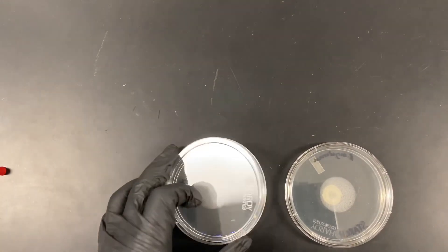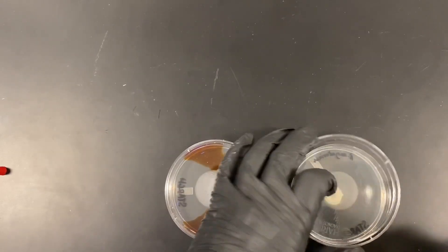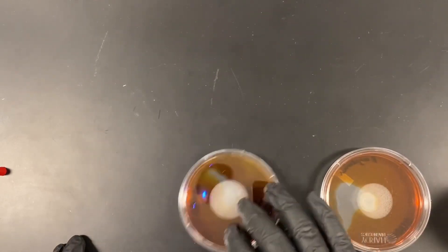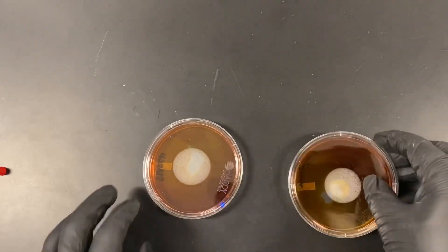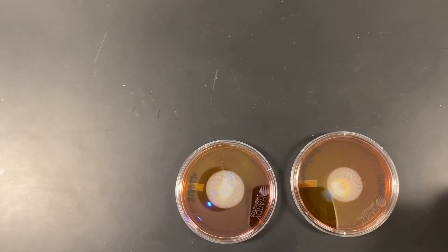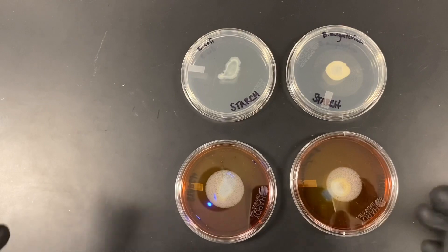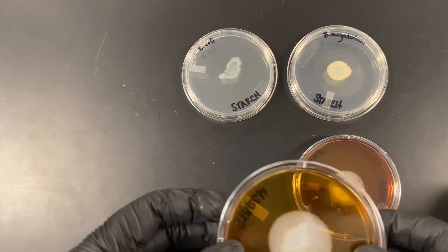We open the plates and add a small amount of iodine, then move it around a little so it covers the entire surface, adding a bit more as needed. We give it a little time to react. After some time passes, we look for a zone of clearance around where the inoculation originally was. Here we have a couple of other plates inoculated in the same way, and we're going to let them sit for a bit longer before observing.